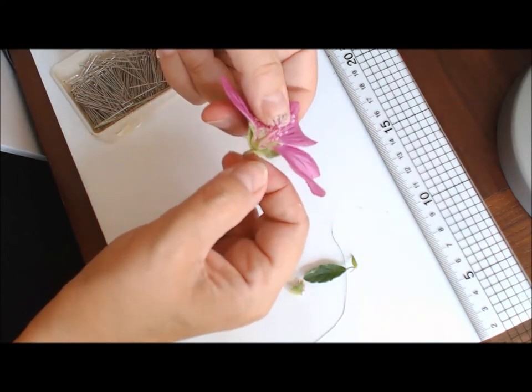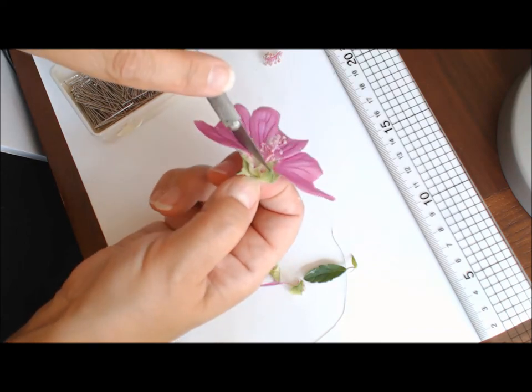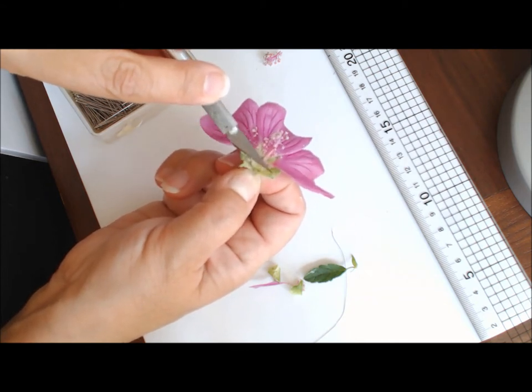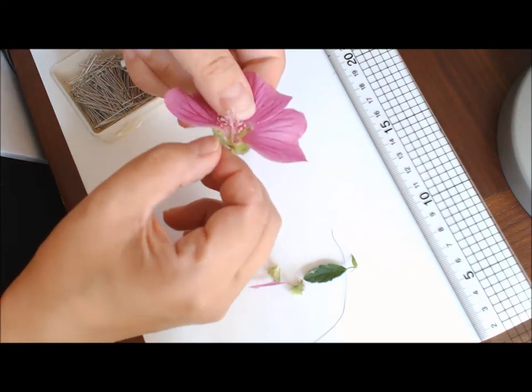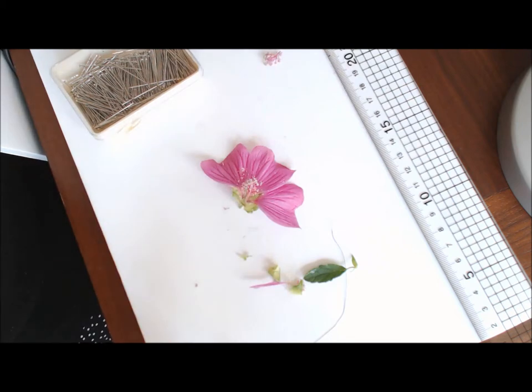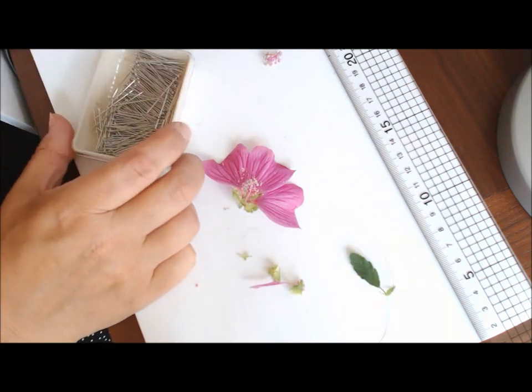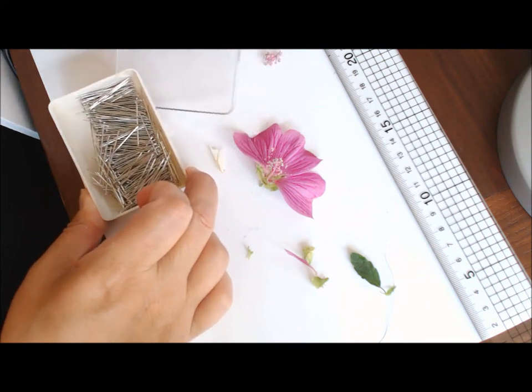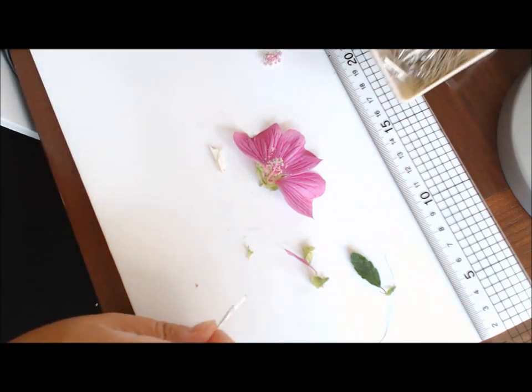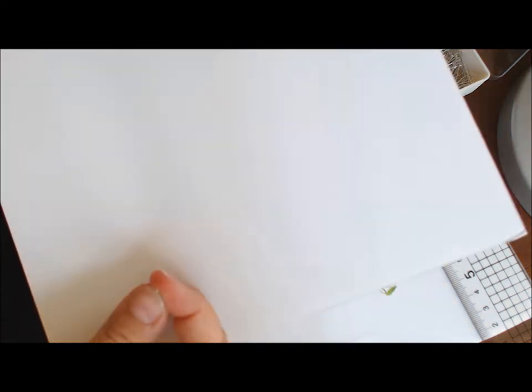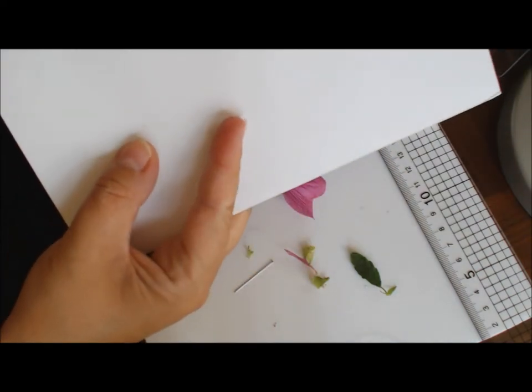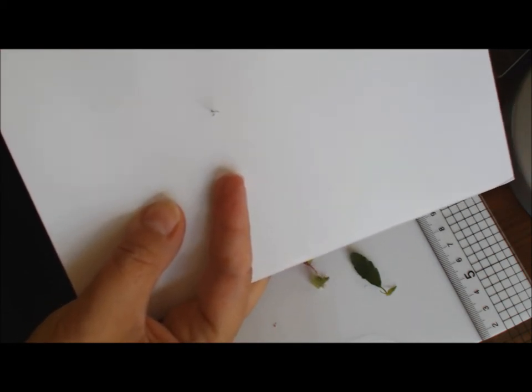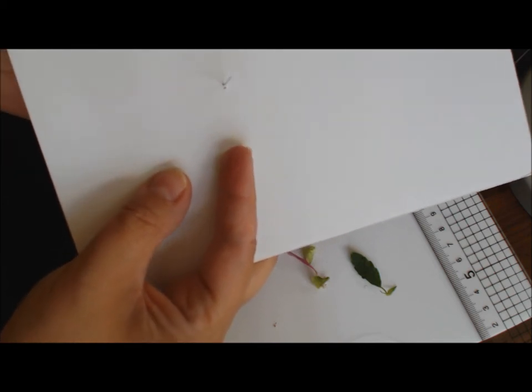That's given me a good dissection of the flower. I'll probably want to take a little bit more off it so I can just shave away with the knife just to get straight into the center. What I tend to do then is either take a dressmaking pin—it's quite good for this because it's quite firm—or the wire. Take a separate piece of foam board, put that through the back. Make sure you can see that. Put that through the back of the foam board as straight as possible. I didn't put that through very straight because I'm watching the screen. Push it through like so.